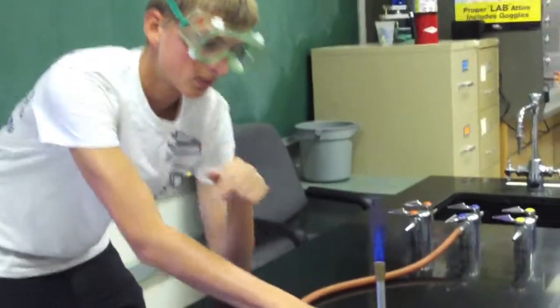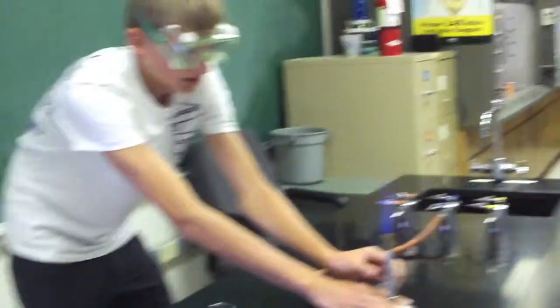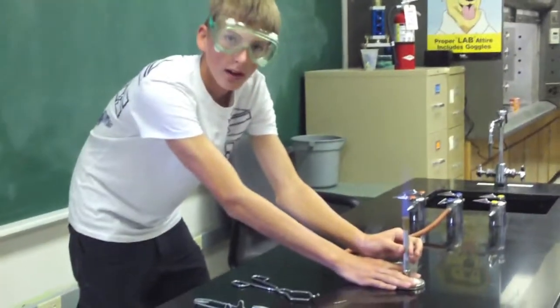My hand's on this Bunsen burner, making sure it's stable. If I need to move it around, this barrel right here is still cool.